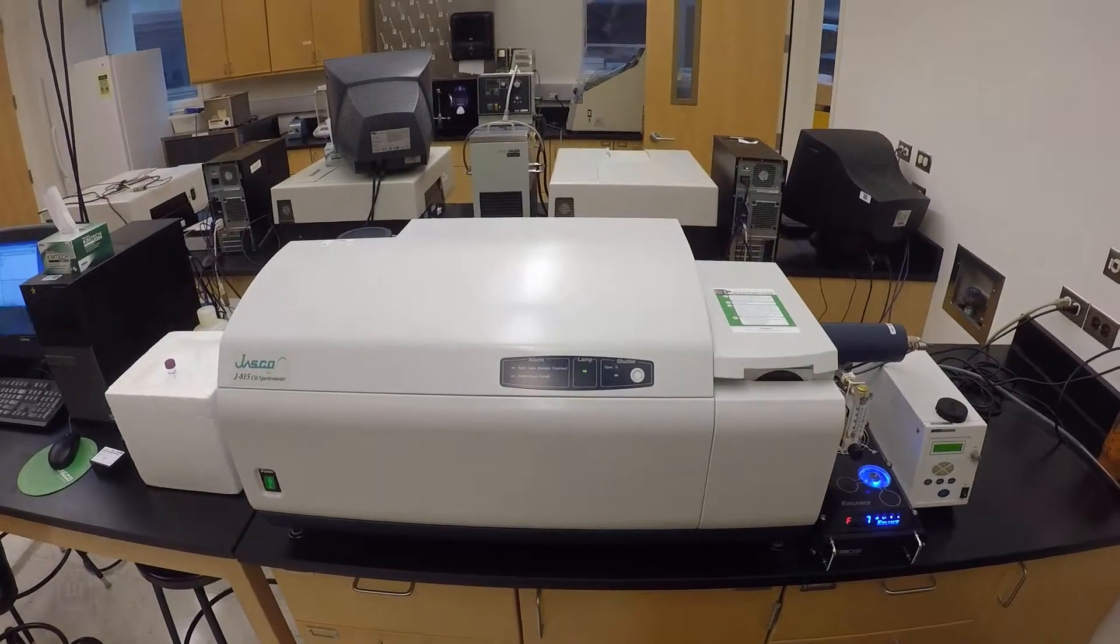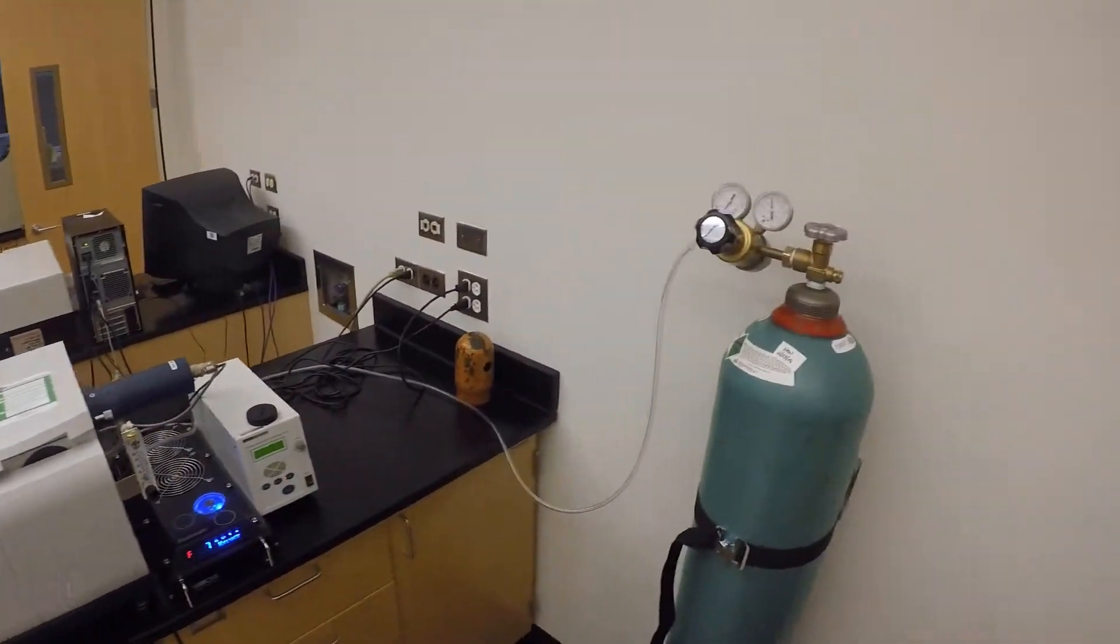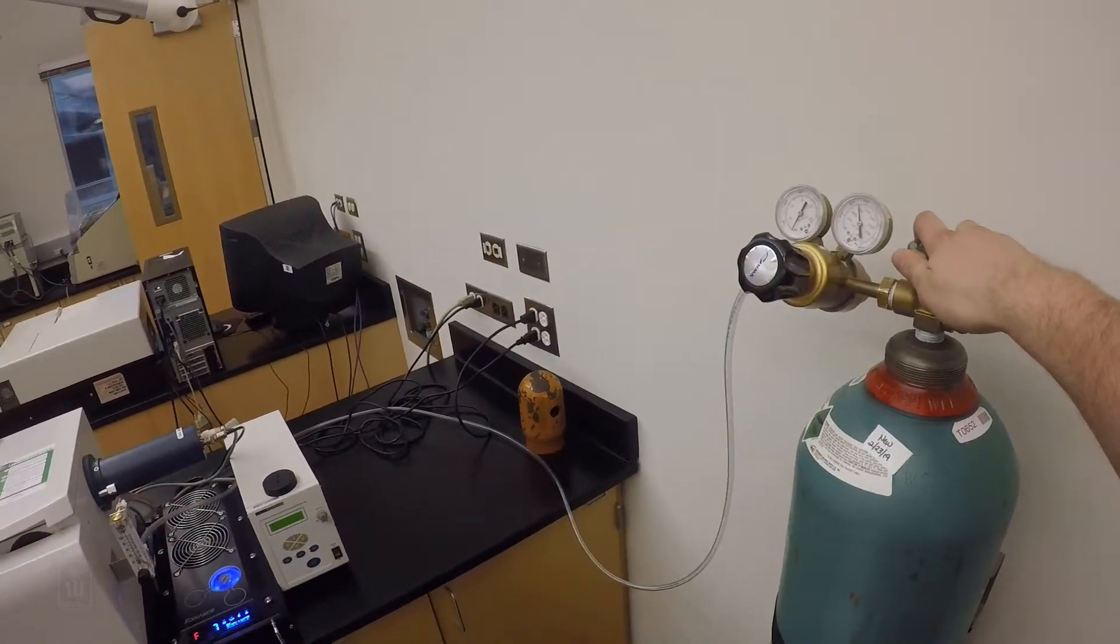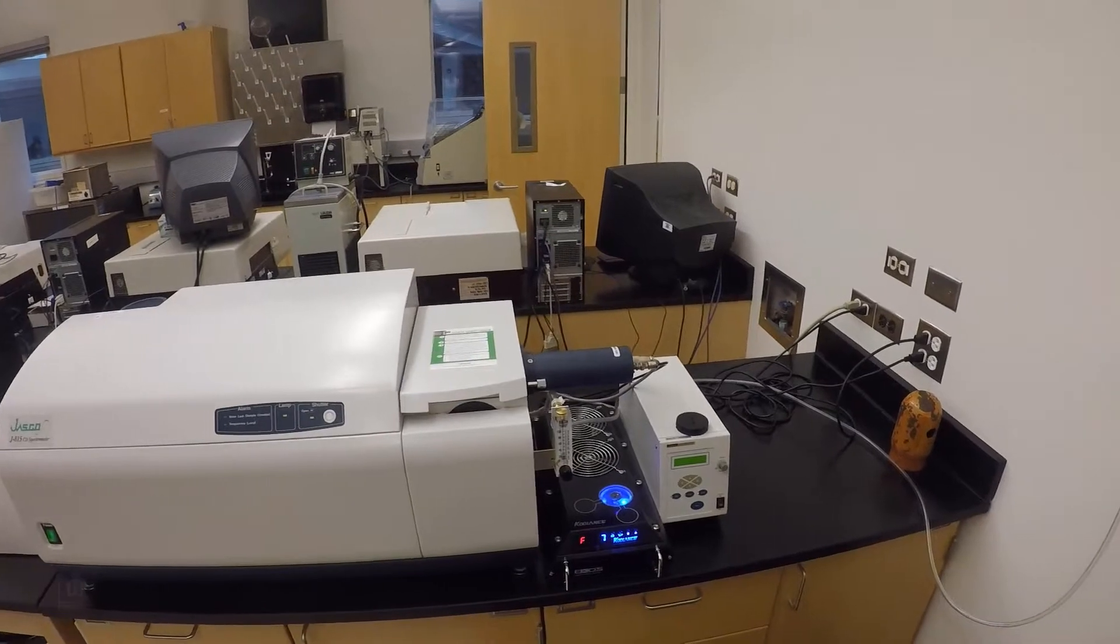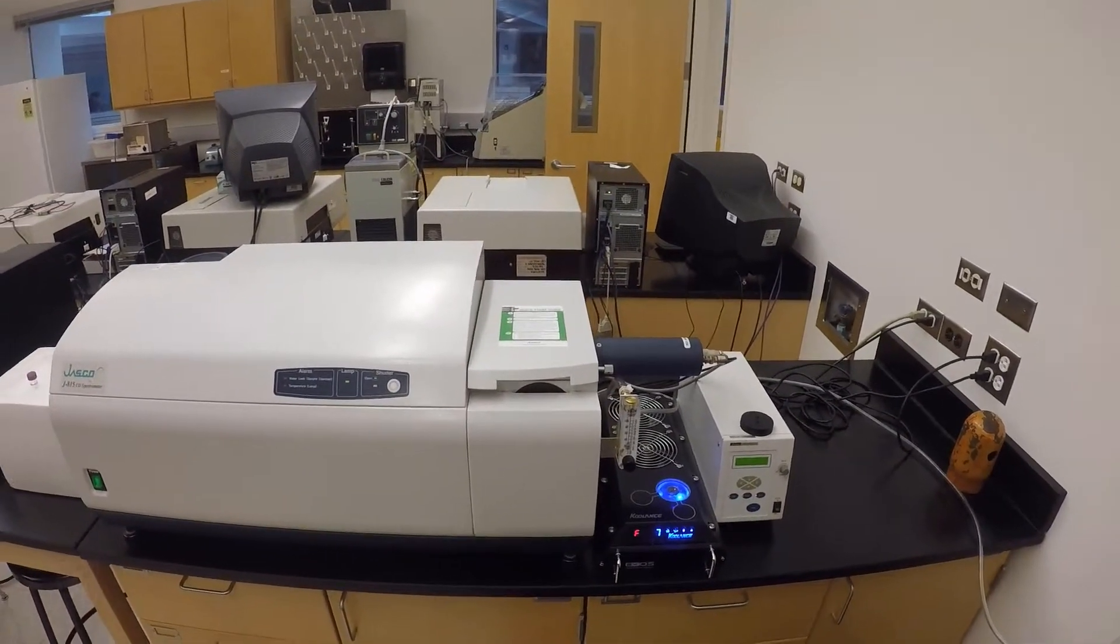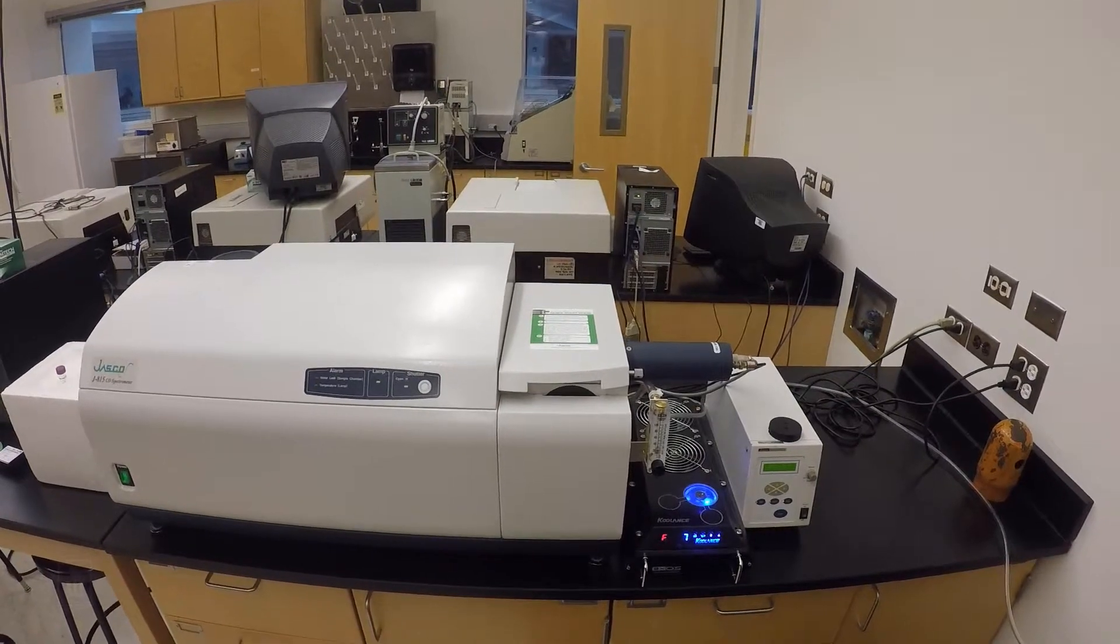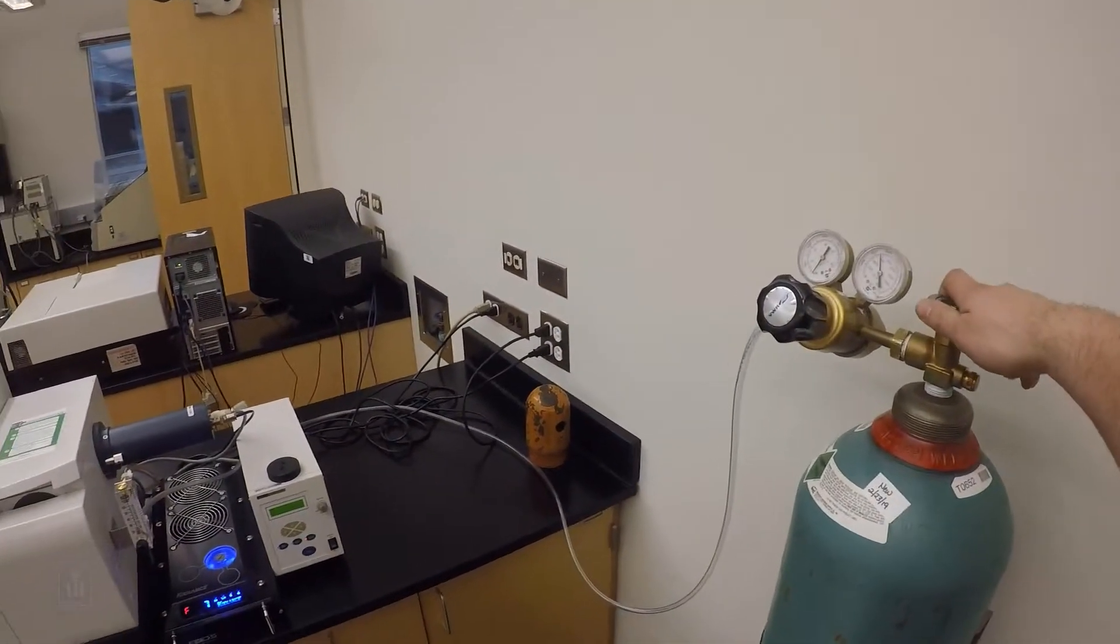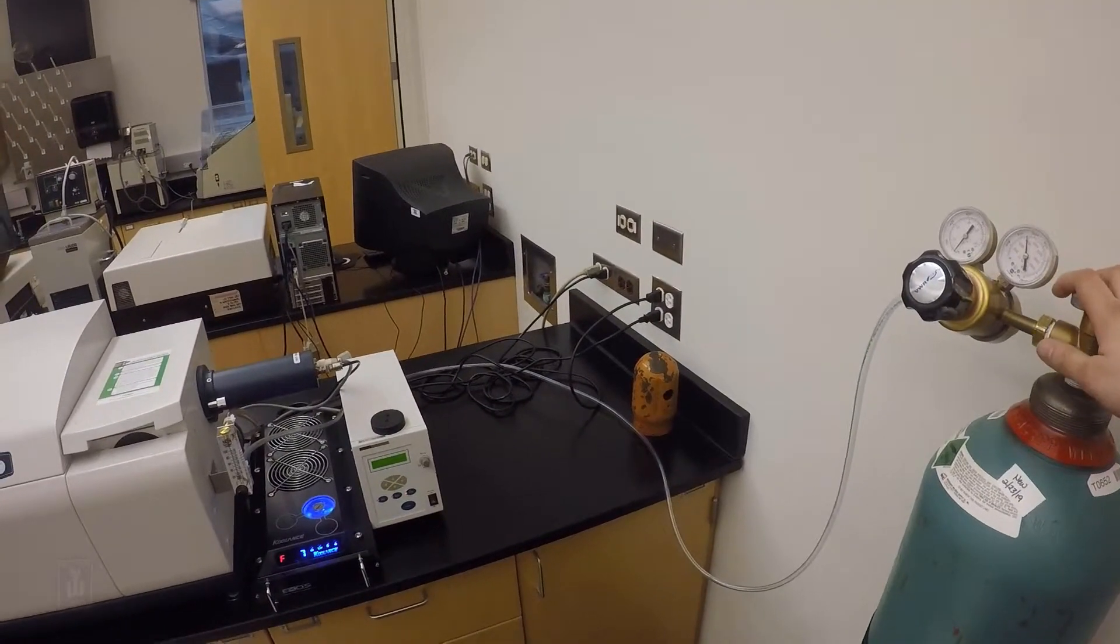The 815 is relatively self-contained. It also uses a tank of nitrogen which you need to turn on when you start this. It flushes out the optics and keeps oxygen away. Oxygen is our main enemy for circular dichroism because it absorbs in the wavelengths that we want to study, so you need to purge the optics with nitrogen which is over here, so be sure to turn that on.